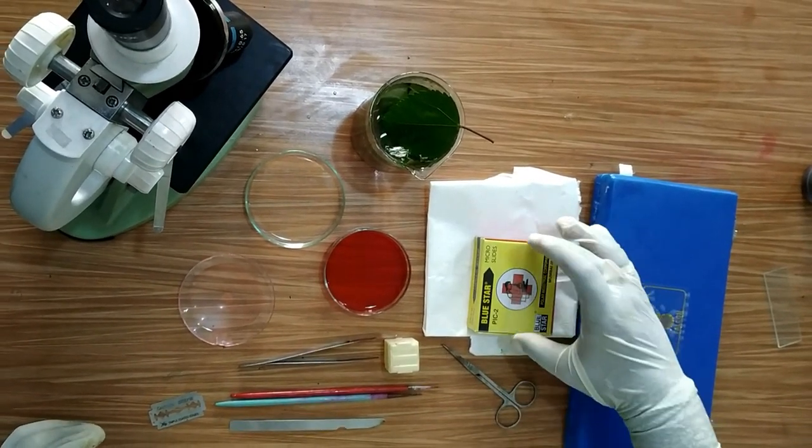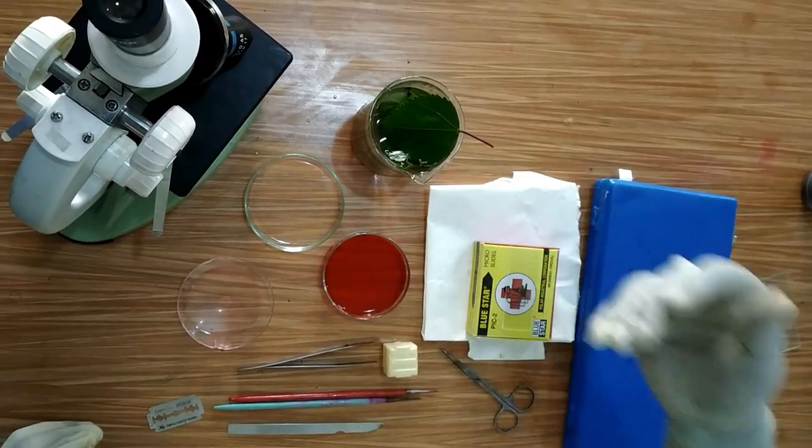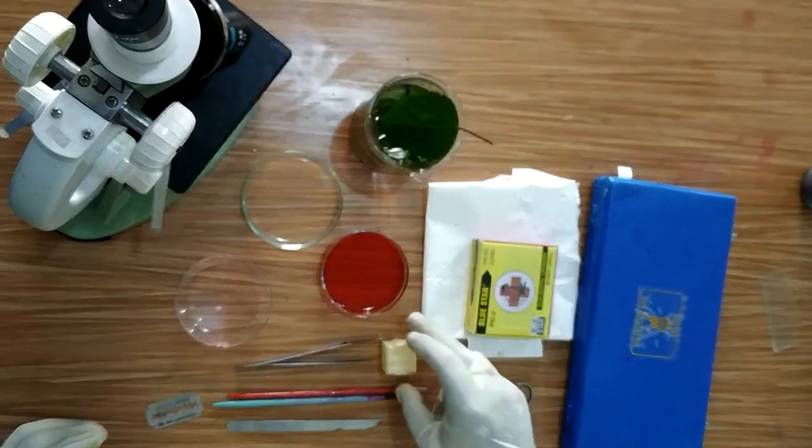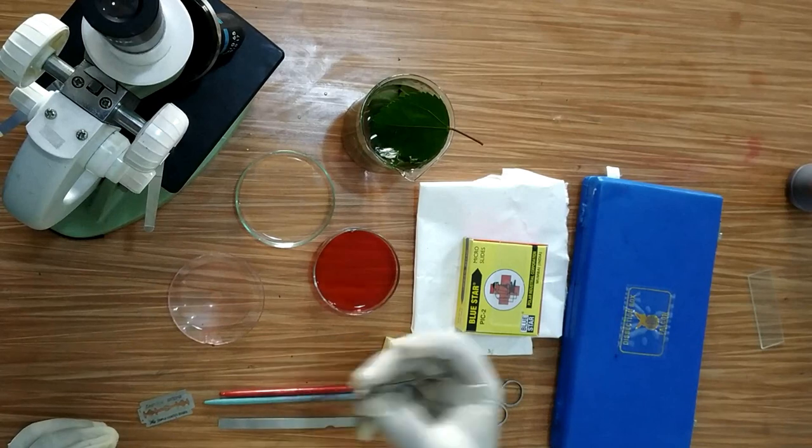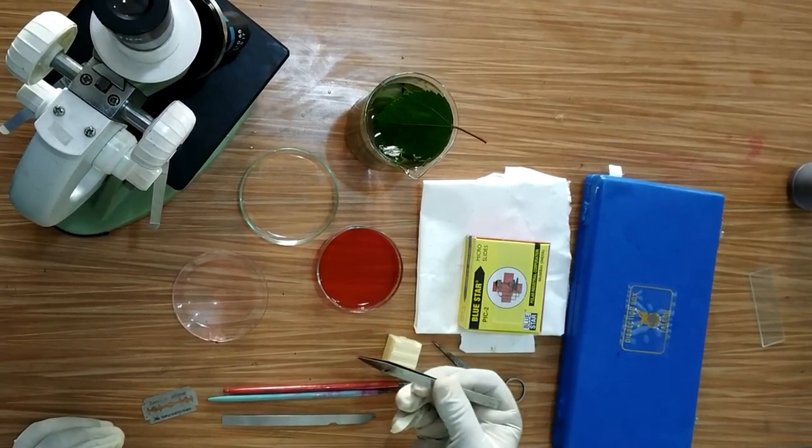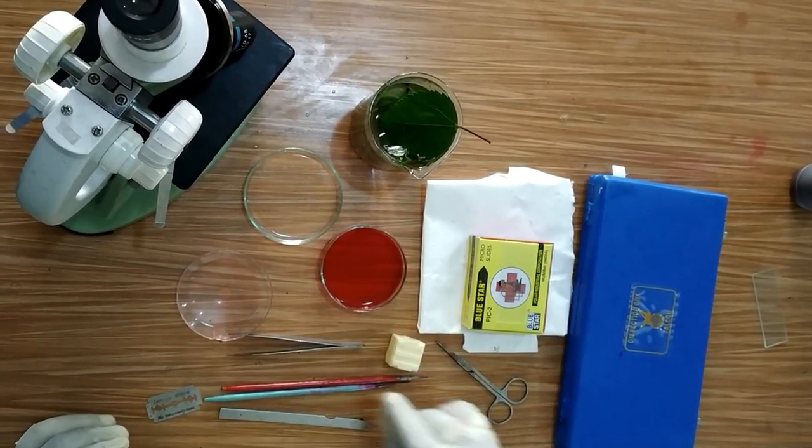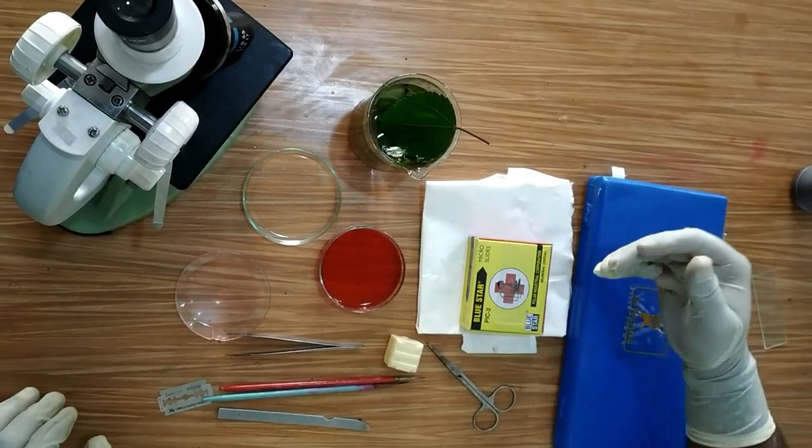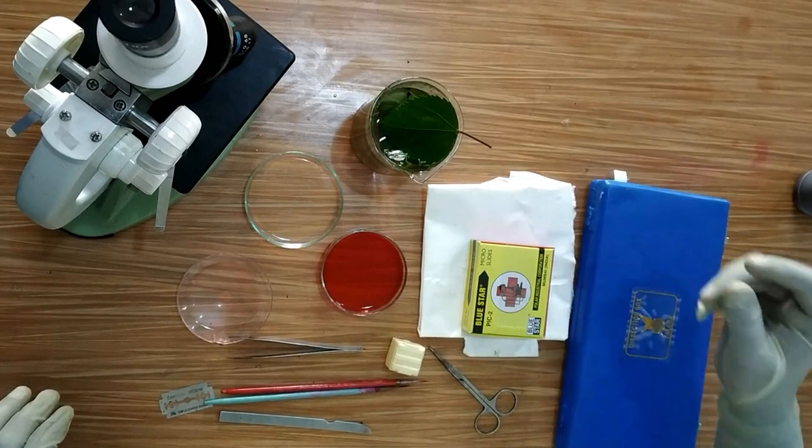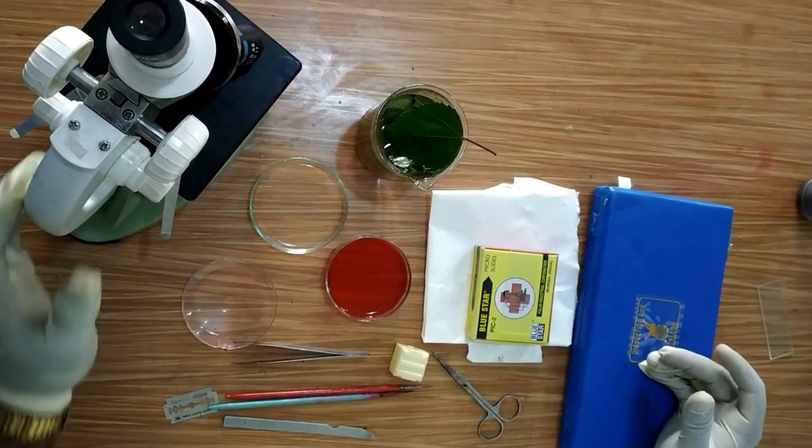We also need slides where I will keep the epidermal peel, cover slips to cover the epidermal peel, forceps, scalpel, brush, scissors, blade, absorbent paper to soak excess stain, and finally a compound microscope to observe the stomata.